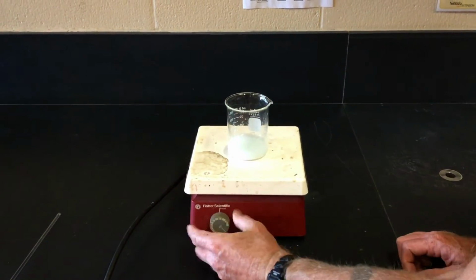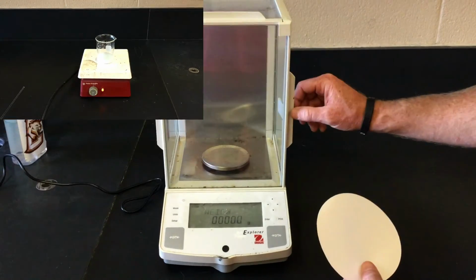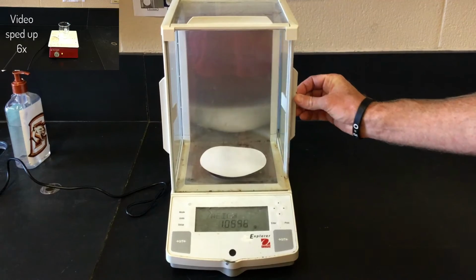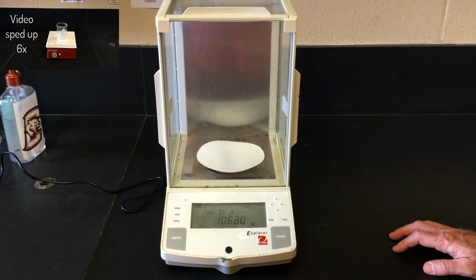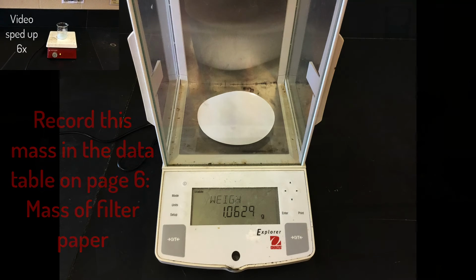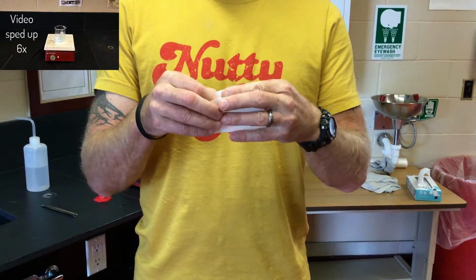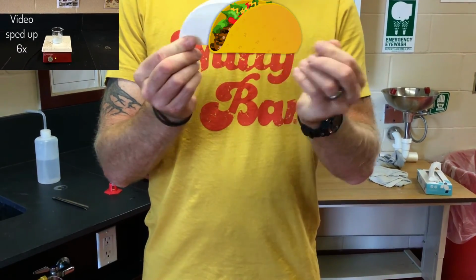Now heat the new solid you just made for a few minutes on the hot plate. While we are heating that solution, we can prepare for gravity filtration. Get the mass of a piece of filter paper using the balance that reads to the 10,000ths place. Record this mass in the data table at the bottom of page 6 where it says mass of filter paper. Now fold this piece of filter paper so that you can use it for gravity filtration.